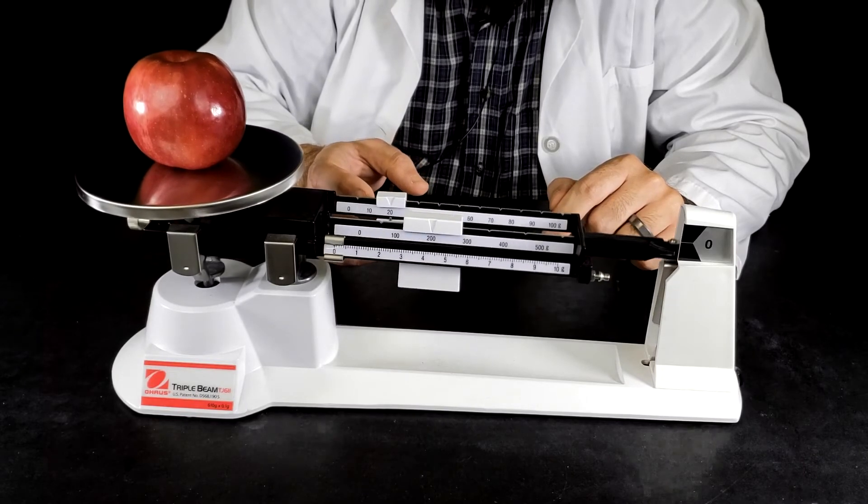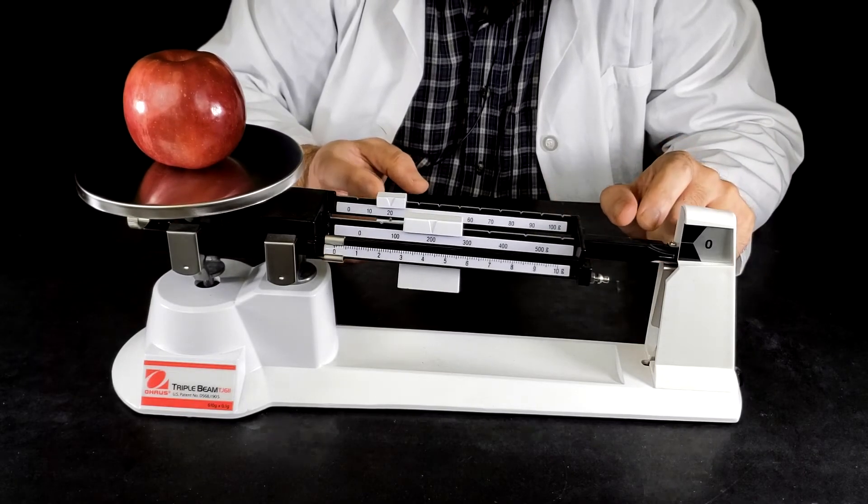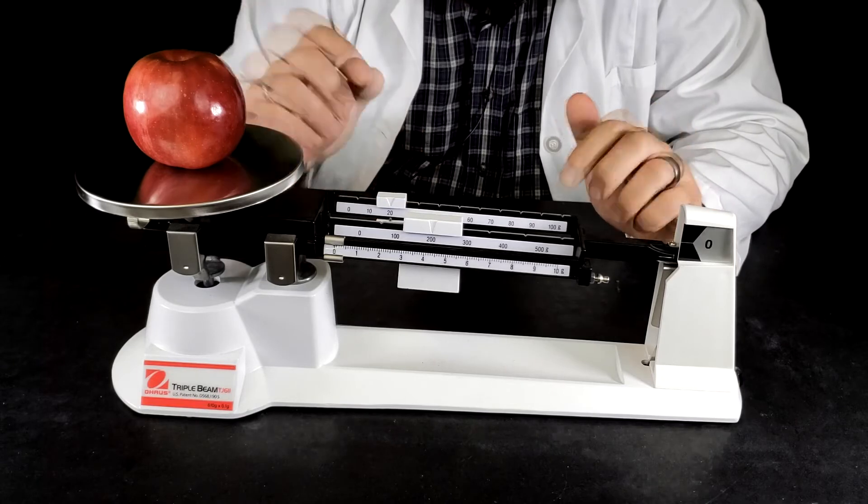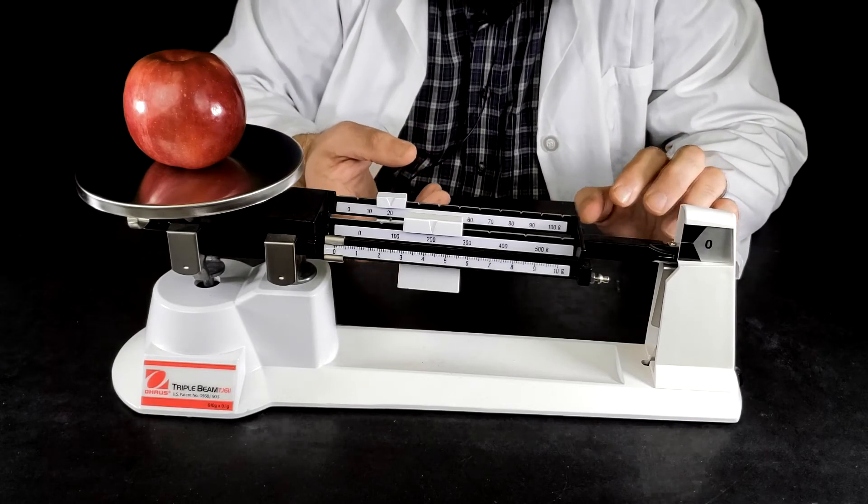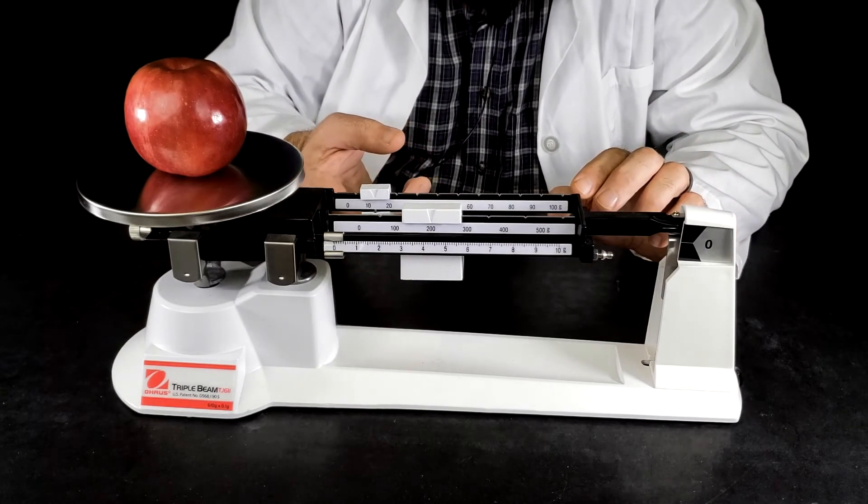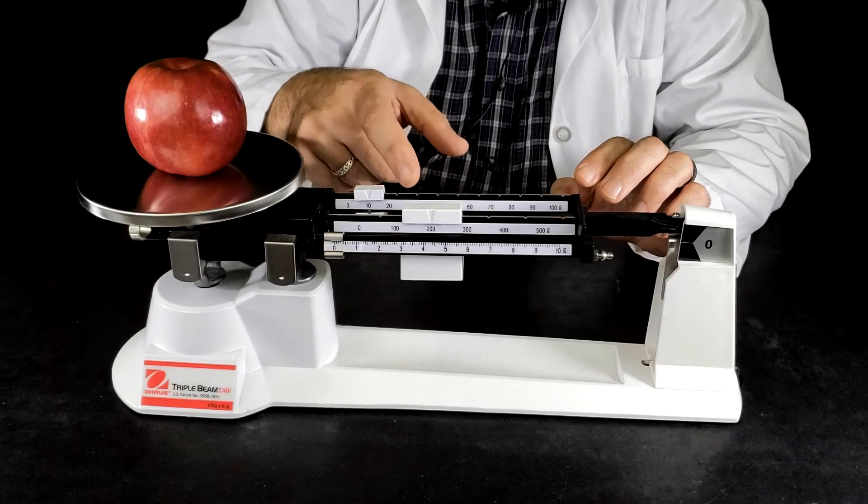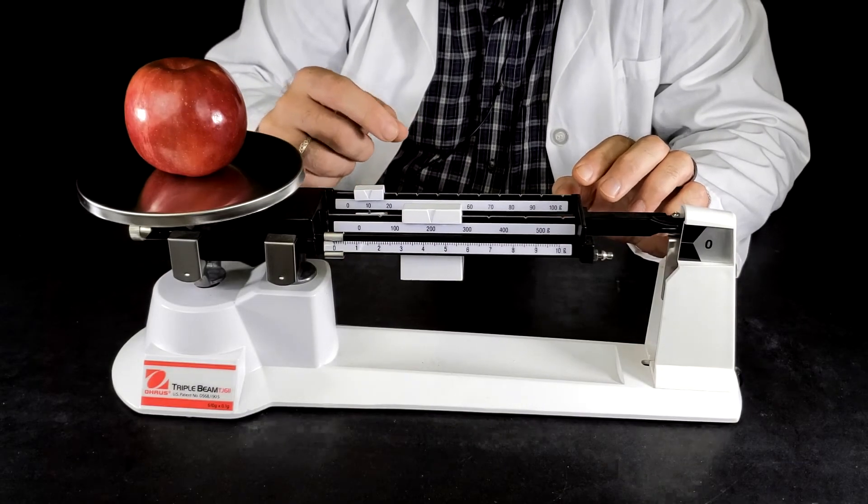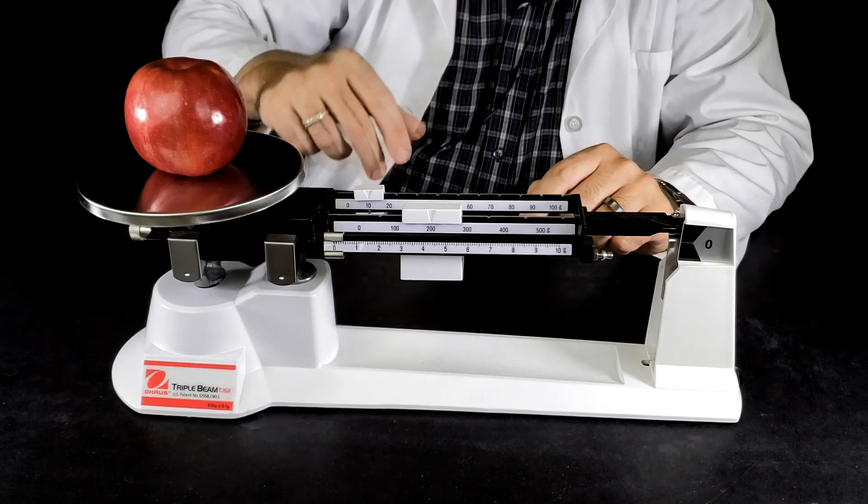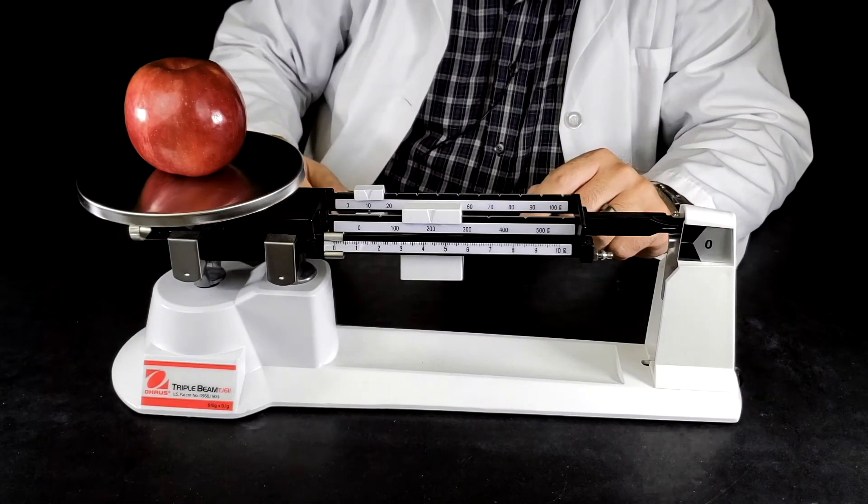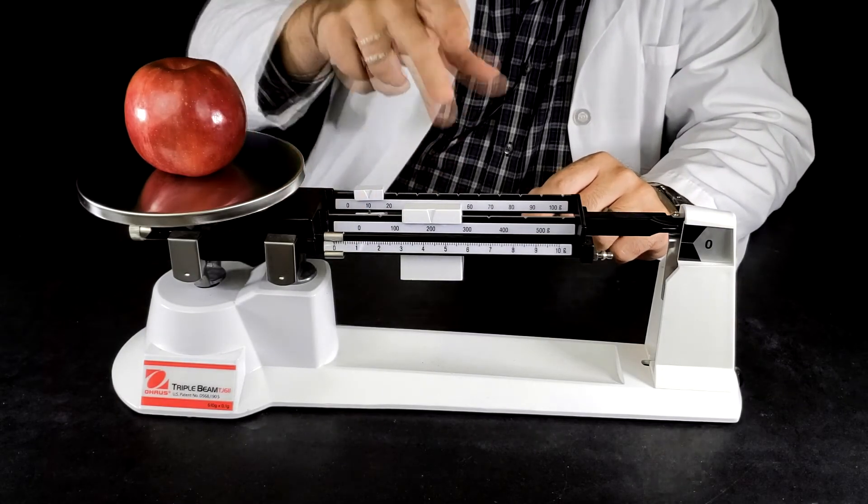220 went down so that tells me that my correct mass is somewhere between 210 and 220, so I'm going to back it up to 210 and then I'm going to move to the other side of the camera here to do the fine adjustment.